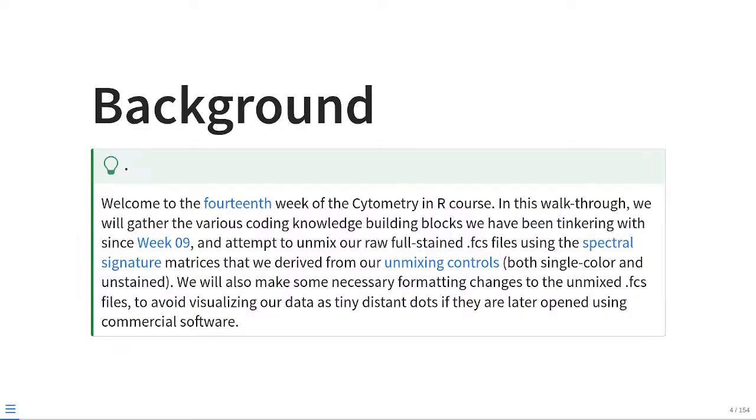In the course of this walkthrough, we're going to gather the various bits of coding knowledge, building blocks that we have been tinkering with since week 9, and attempt to unmix our raw full-stain FCS files using the spectral signature matrices that we have derived from our unmixing controls, both single color and unstained. We will also make some necessary formatting changes to the unmixed FCS files so that we avoid visualizing our data as teeny tiny distant dots when we open them later on using the commercial software.